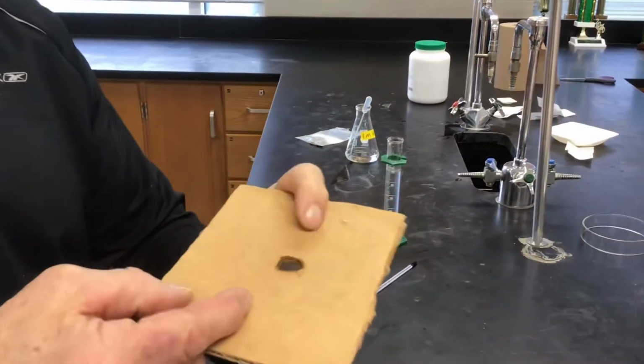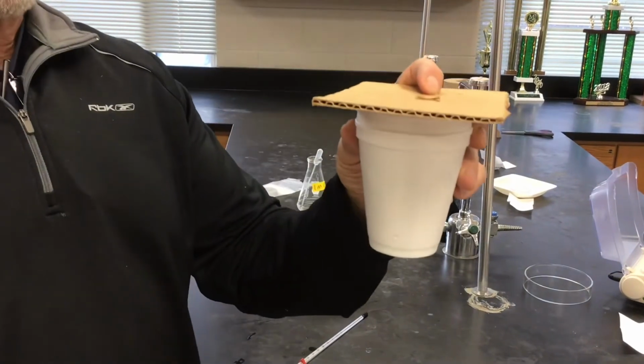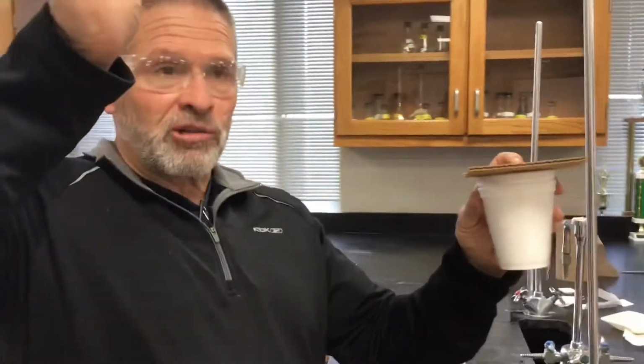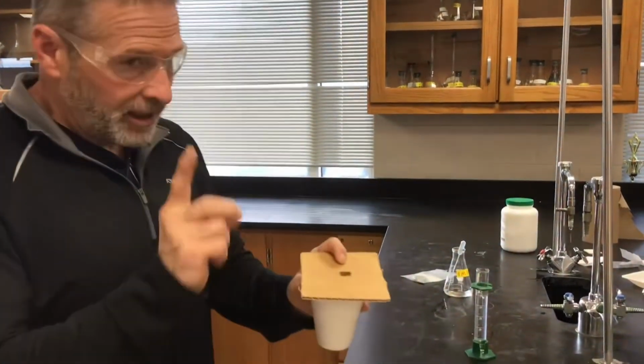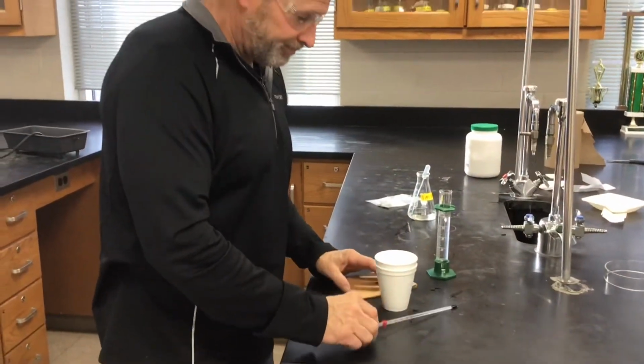It was, for sure. But it is important. With coffee cup calorimetry, you're assuming that all the heat flow is occurring inside the cup. And we have insulated the inside of the cup from the rest of the surroundings. There's nothing out here that's going to influence the heat flow in there. Styrofoam is cheap, but it works really well.